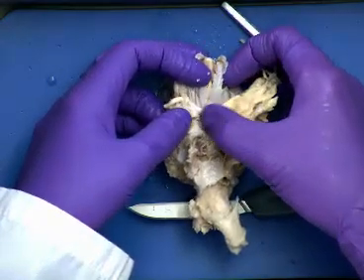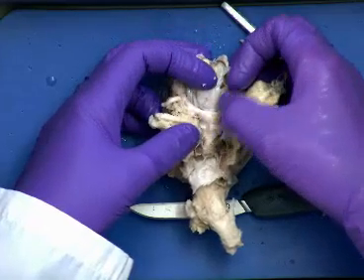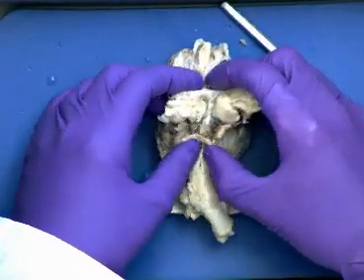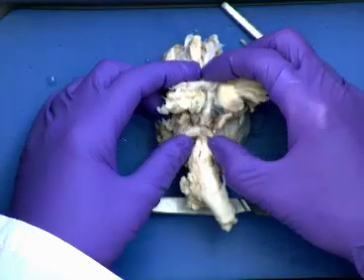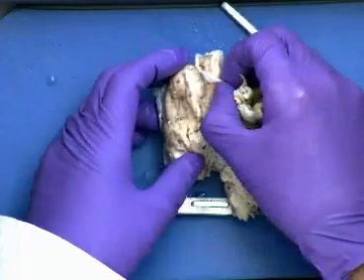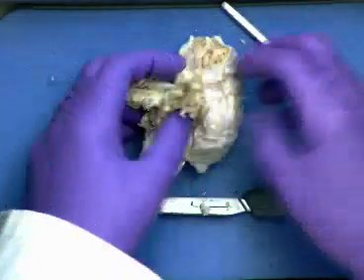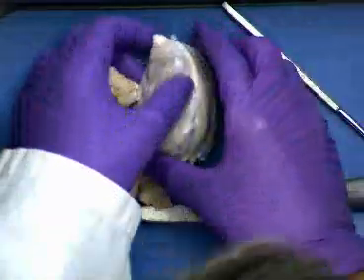This is the optic chiasma, where the optic nerves are coming in and joining and then forming that X that we talked about. But you'll notice that the dura mater wraps a lot of the cranial nerves, wraps the pituitary gland, etc. So I'm going to have to take off the dura mater so that we can see our brain structures, and likely a lot of this is going to come with it. That's why I wanted to highlight it ahead of time. But you can also see how the dura mater goes in between the two cerebral hemispheres as well. It dips down into that longitudinal fissure. So we're going to work on removing that.